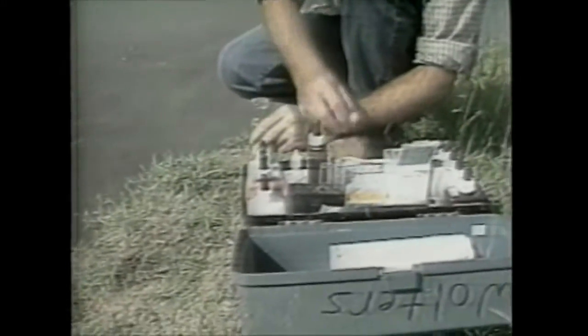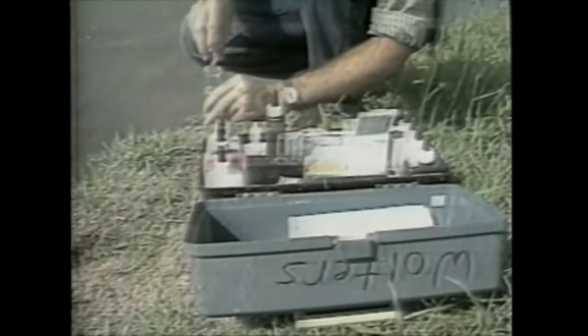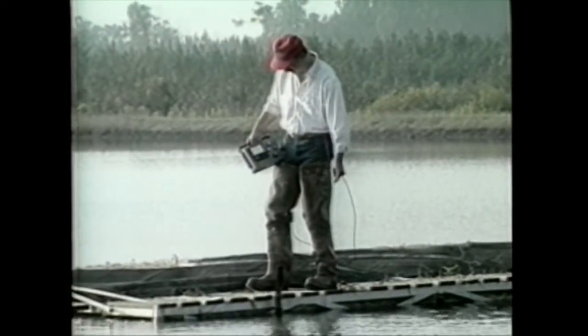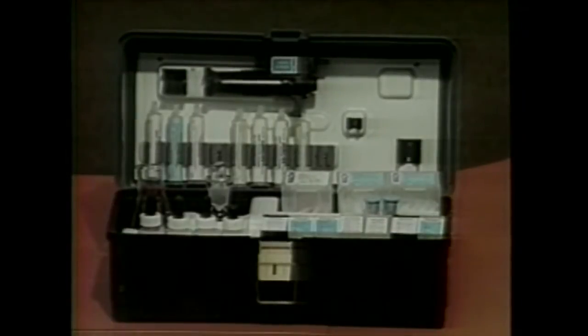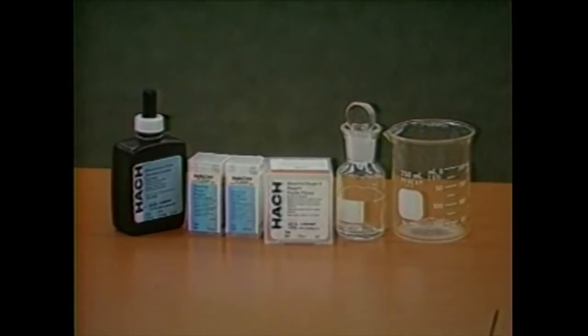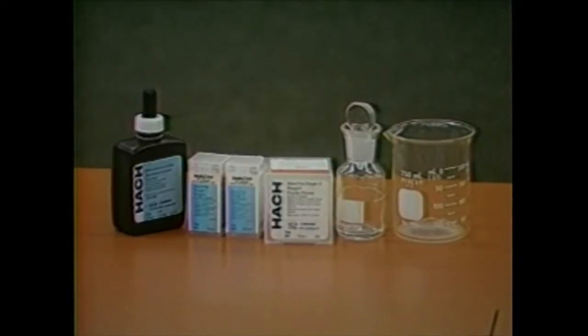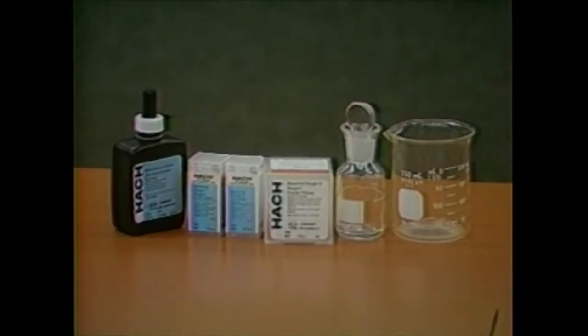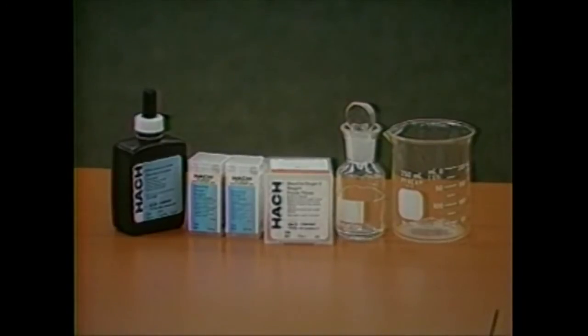Dissolved oxygen. There are two methods of dissolved oxygen determination: the use of chemical kits and polarographic meters. The kit method is usually more practical for a small producer or pond owner, while the use of meters is usually preferred on larger commercial operations. Kits may be purchased from scientific supply companies or from fish farming supply houses. Included in the test kits are high range and low range methods for dissolved oxygen determination. Initial testing should start with the high range method.